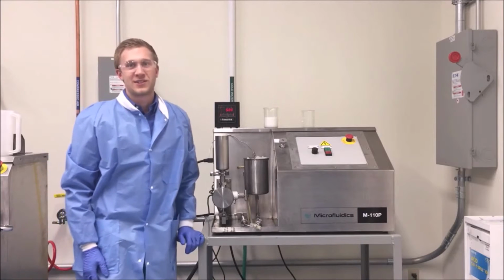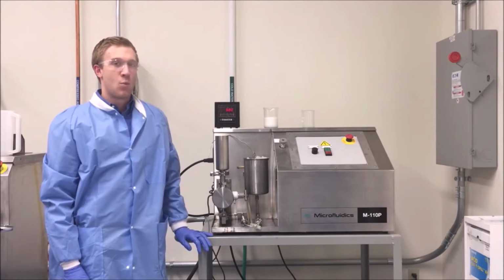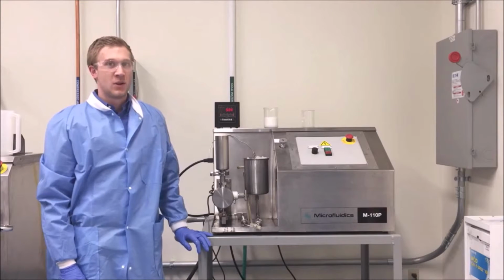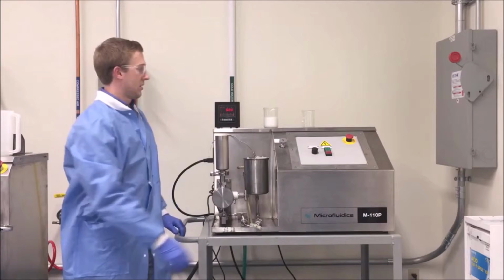Hi, welcome to the Microfluidics Technology Center. I'm Kyle Jandrasitz, and today we're going to process on the M-110P Microfluidizer. We're going to process a Squalane emulsion through a Y-type chamber.